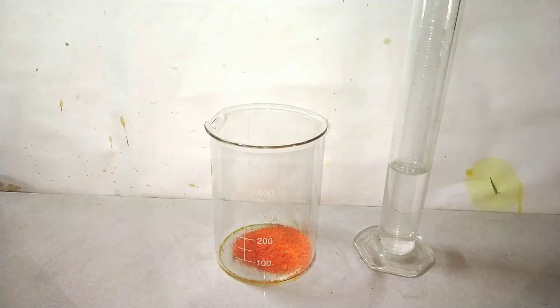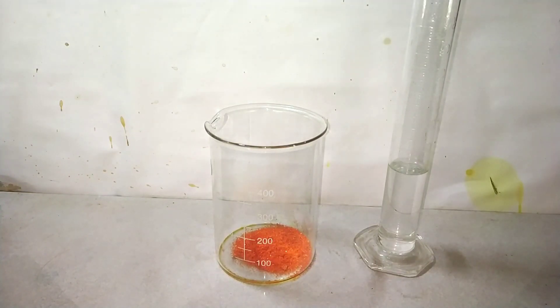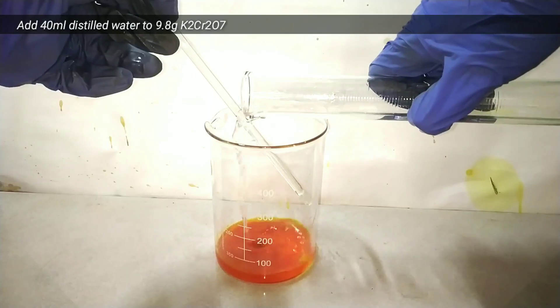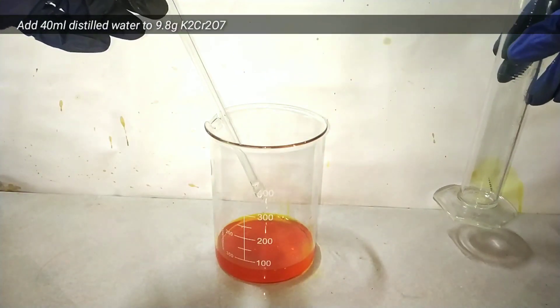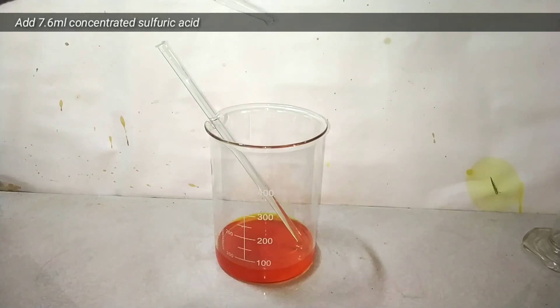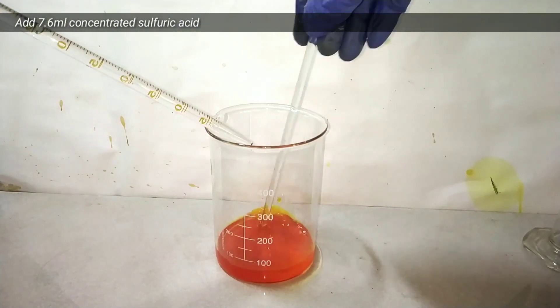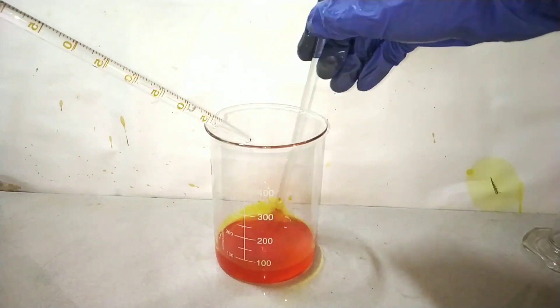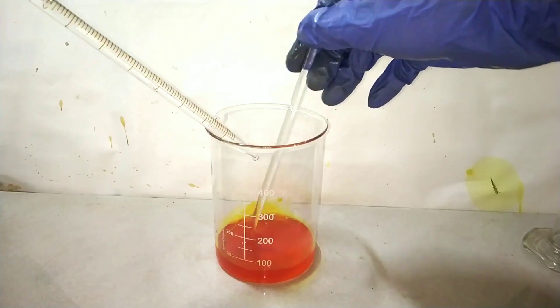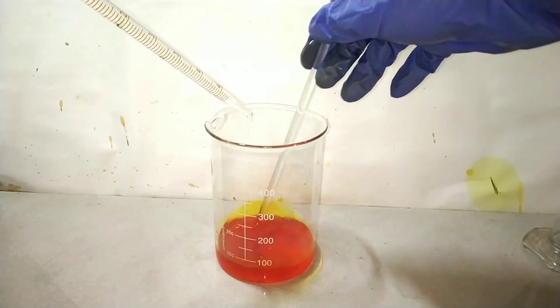Start by taking 9.8 grams of potassium dichromate in a dry 400 ml beaker and 40 ml distilled water in a measuring cylinder. Add the water into the beaker containing the dichromate to make the solution, then add 7.6 ml of 98% sulfuric acid slowly with stirring using a pipette. This acidification of potassium dichromate is essential for the next step.